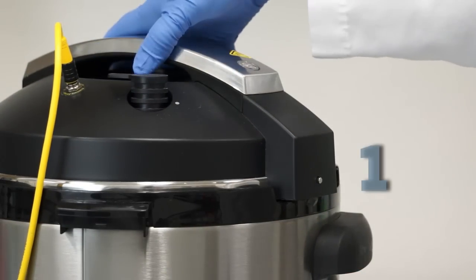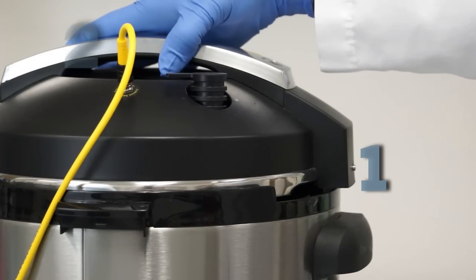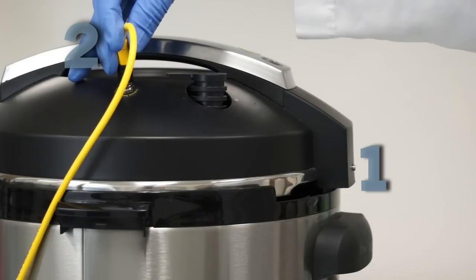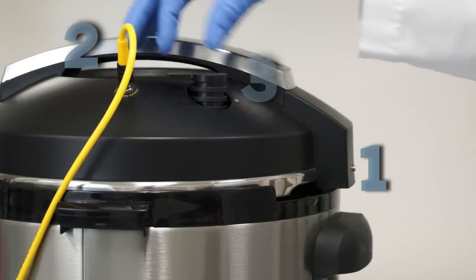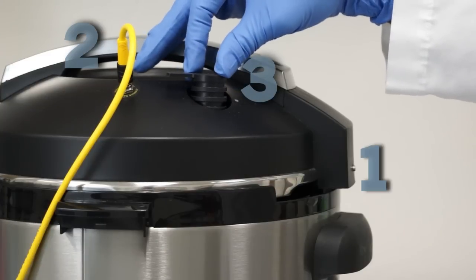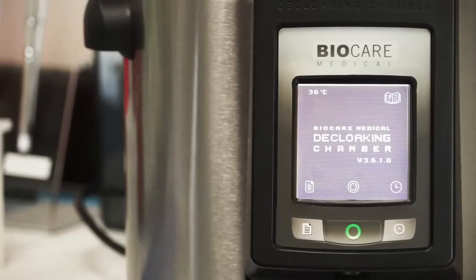ensuring that one, the lid is fully locked into place, two, the pressure cable is securely attached to the lid, and three, the pressure limit valve is level and set directly on the pressure stem.